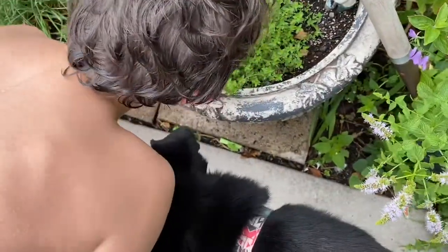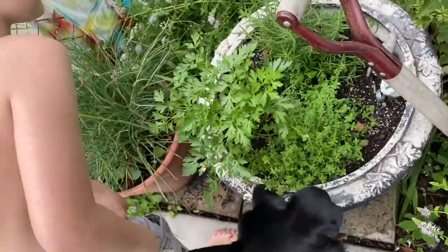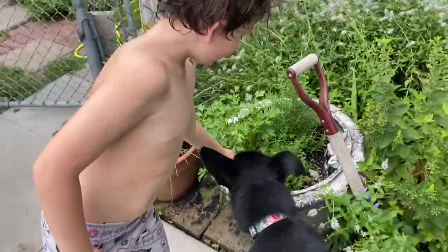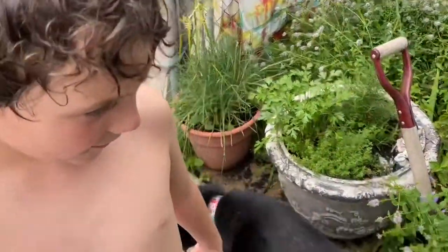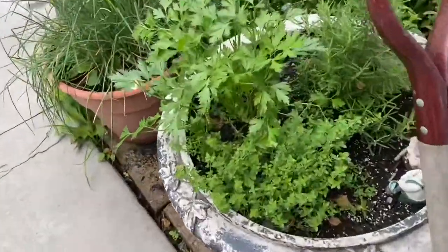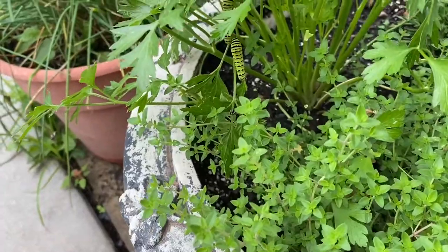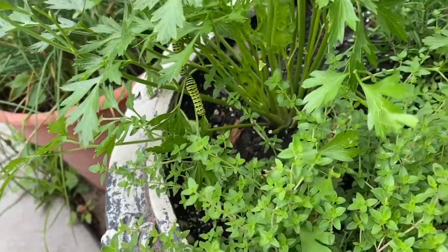The child's like, 'What is going on here? What are they so interested in?' I put three parsley — why do you guys like parsley? Oh, you put them all together? Hopefully one of them doesn't chew the leaf off and drop the other ones.